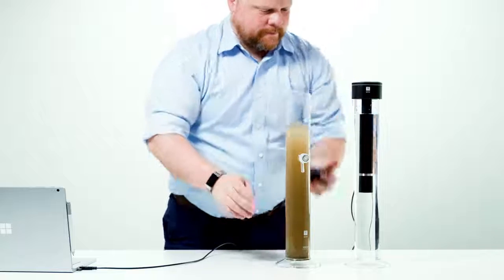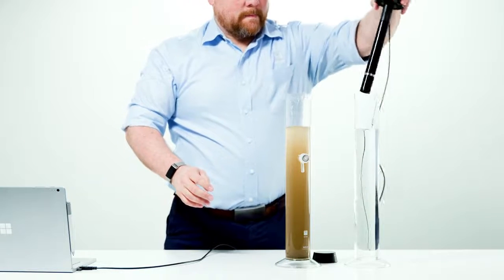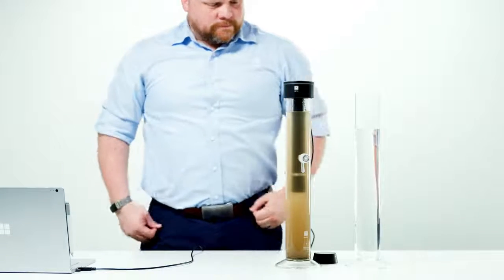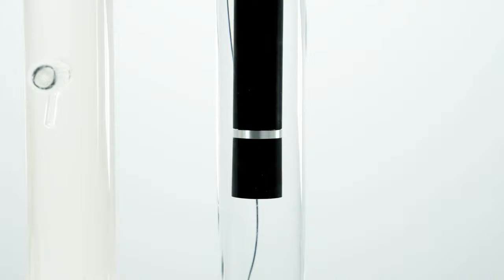Remove the PARIO device from the standby cylinder, bringing it momentarily into a horizontal position. The horizontal orientation is detected by the PARIO Control software and identifies the PARIO device connected to the specific sample during the test. Insert the PARIO device into the sedimentation cylinder, carefully fitting the groove of the PARIO on the rim of the sedimentation cylinder. Be careful not to hit the pressure sensor on the edge of the sedimentation cylinder.